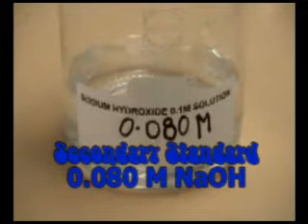In part 3, a 0.08 molar sodium hydroxide secondary standard had been prepared.